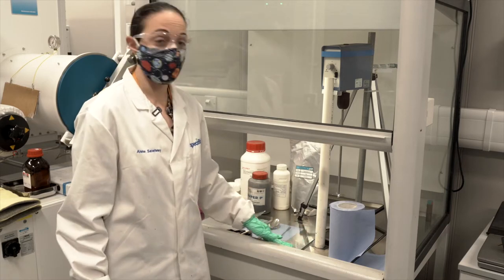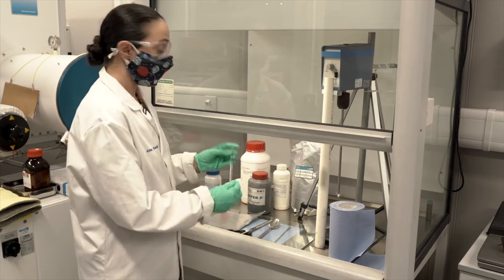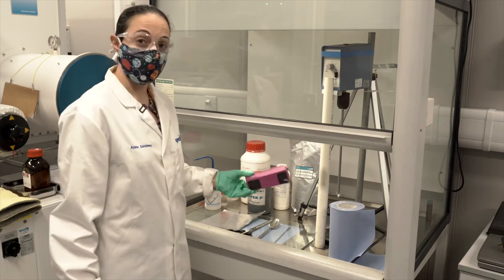I'll be spreading on this glass pane using a glass rod, also from a laboratory supplier. I'll go through some sticky tape.